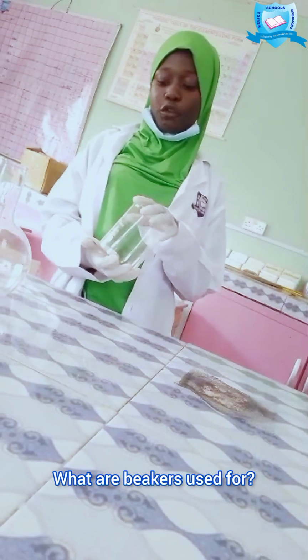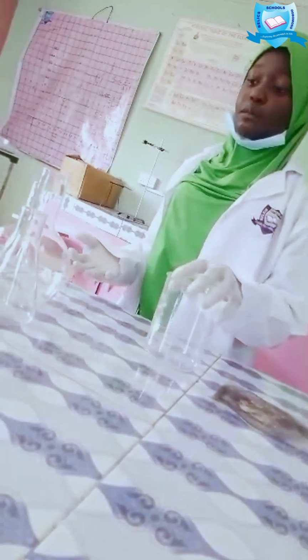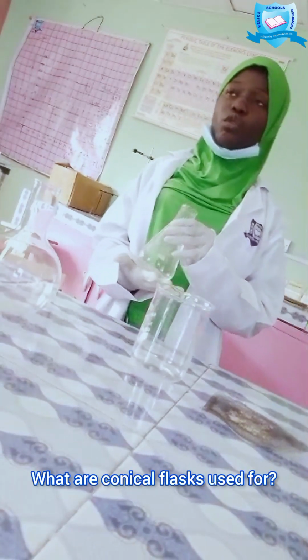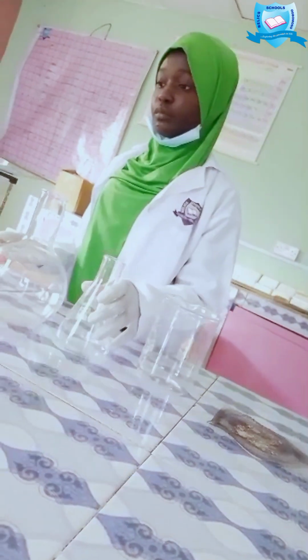What are beakers used for? Beakers are used to hold a solution during an experiment. And here we have our conical flasks. What are conical flasks used for? Conical flasks are used to hold a reactant during a titration.